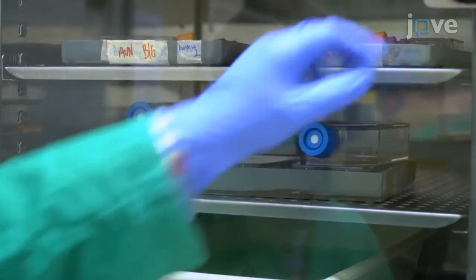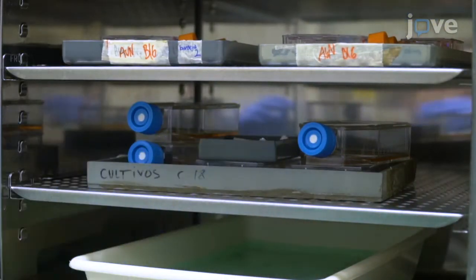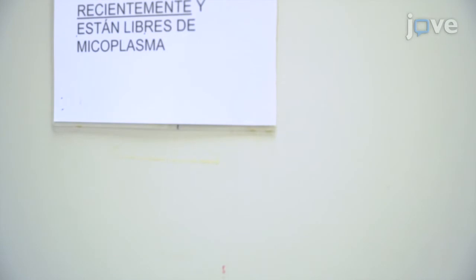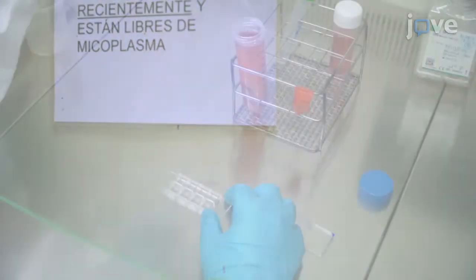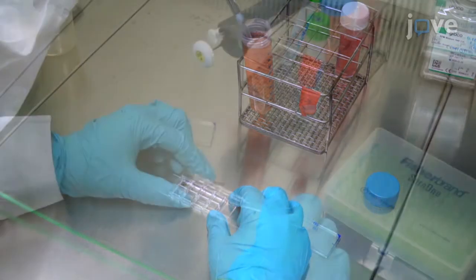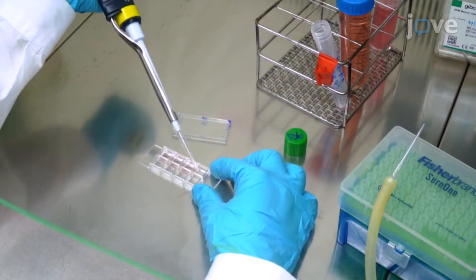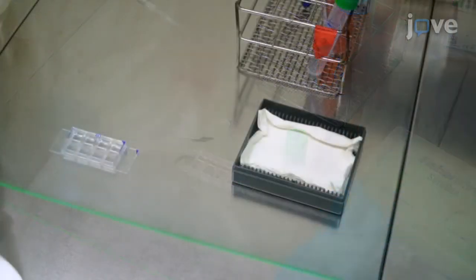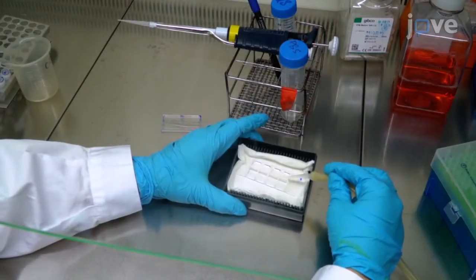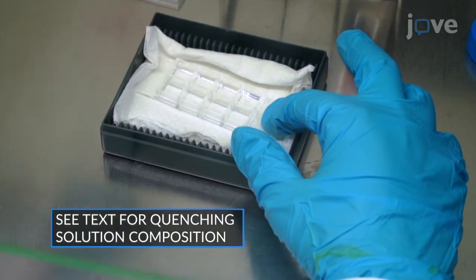If only an endpoint experiment is planned, incubate the chamber slide at 37 degrees Celsius with 5% carbon dioxide for 1 to 2 hours. After the culture period, check for conjugate formation and subsequently fix the conjugates as outlined in the text protocol. To fix the cells, add warm RPMI without FCS and gently shake. Aspirate the RPMI and add 200 microliters of either PFA or pre-chilled acetone to each well. Incubate the chamber slide at room temperature or on ice for 20 minutes. Then, wash each well twice with PBS and add 200 microliters of quenching solution.